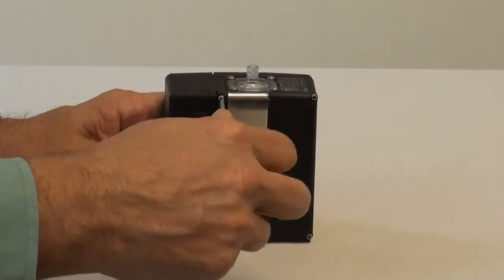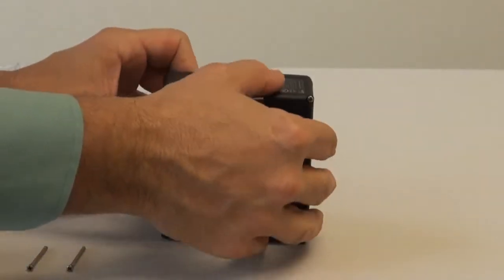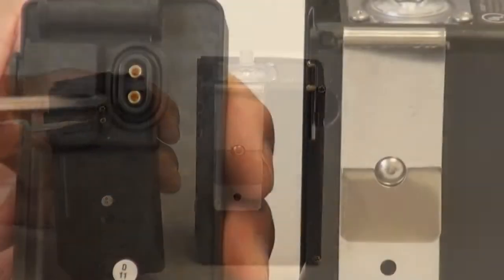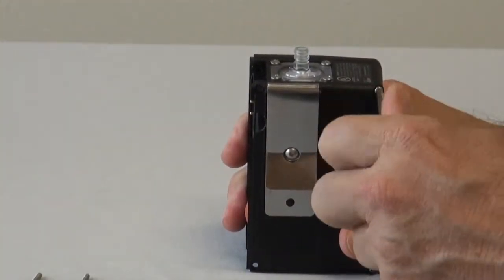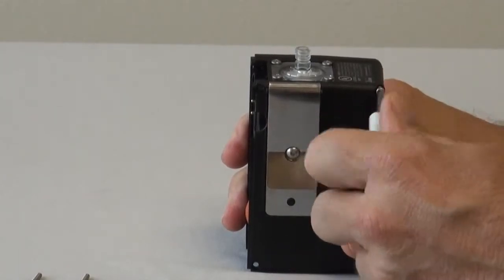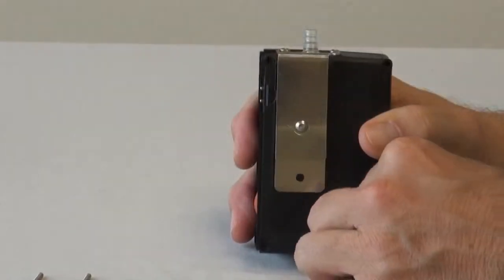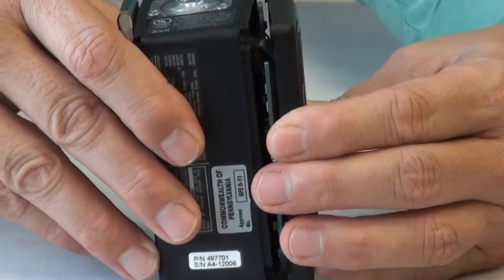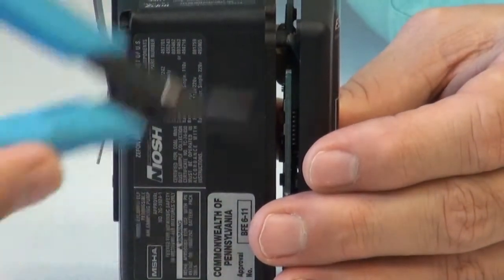To replace the battery pack, remove the 2 screws securing it to the case. Always visually inspect for proper placement and damage of the battery pack O-ring. Now to remove the faceplate, unscrew the remaining 2 screws. As you pull the faceplate away from the case, use a pair of small pliers to gently pull the ribbon cable away from the flow sensor connection.